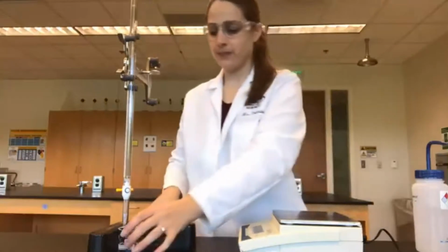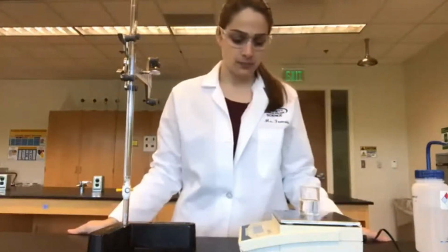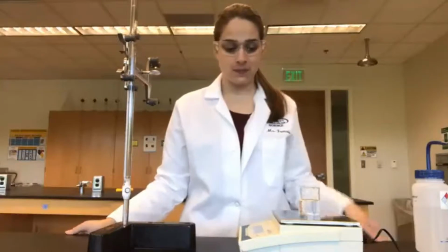Go. Check out our mass. The mass is 58.21 grams.